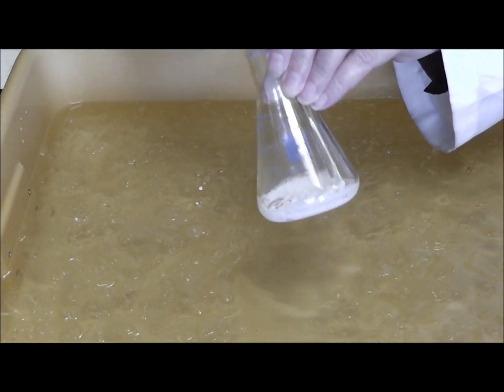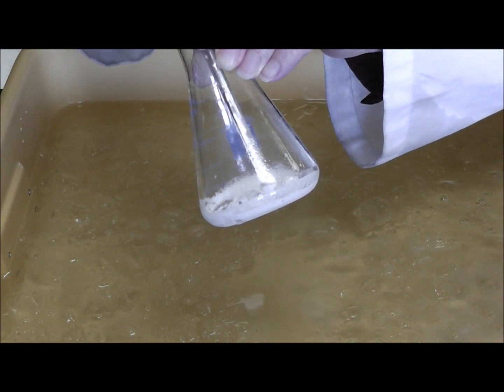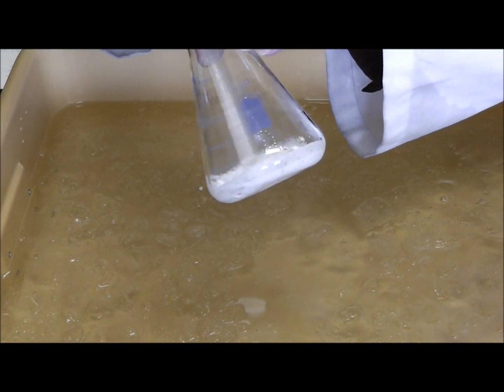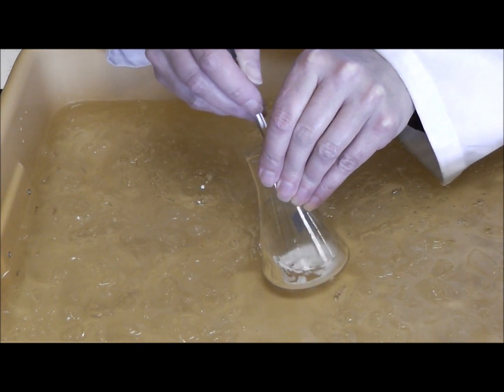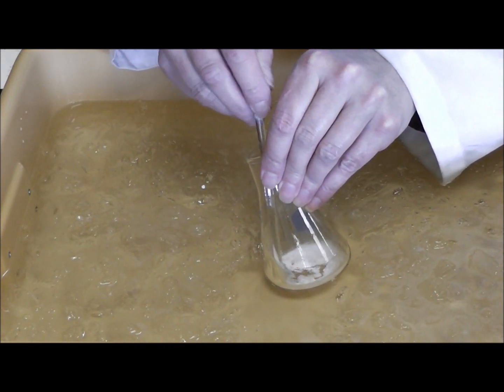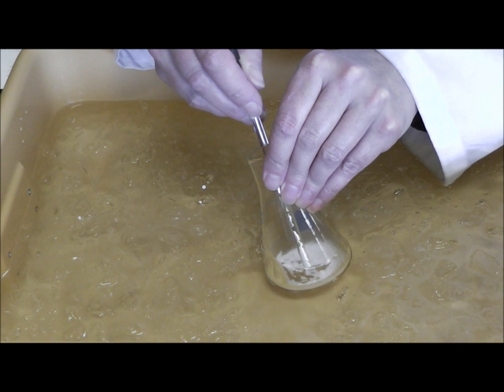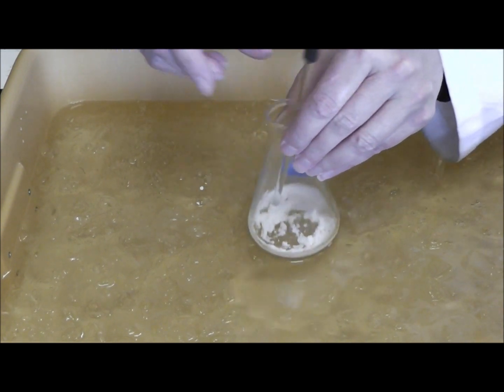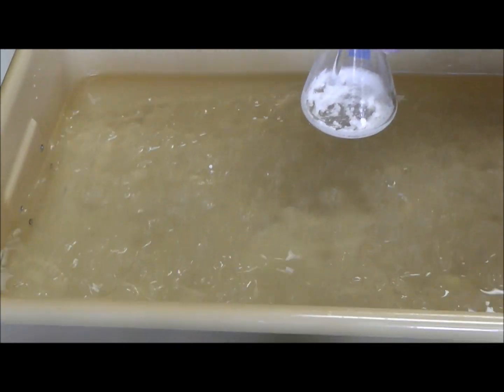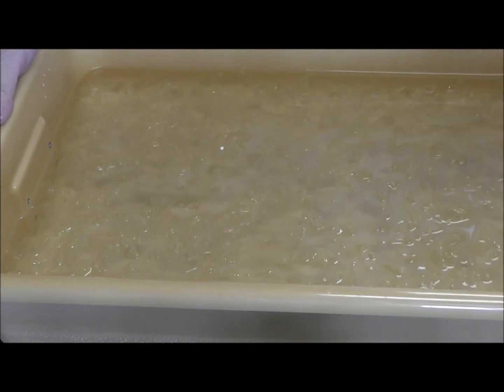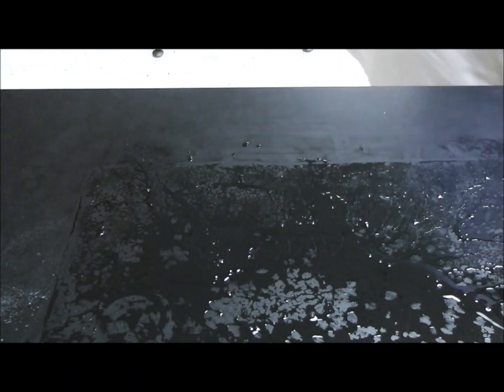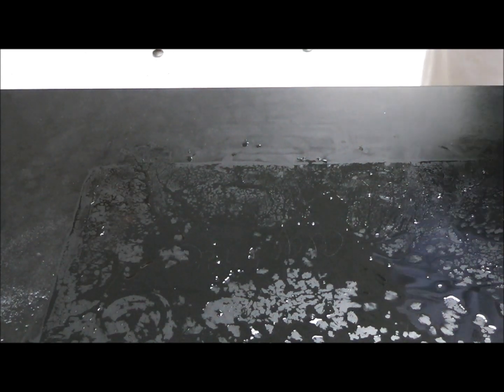And I think that is about everything I want forming. Get that slightly damp, so I will give it a few more stirs. All right, so what I am going to do now, I am going to dry off the part, and I am going to get rid of the water bath, and wipe off my counter.